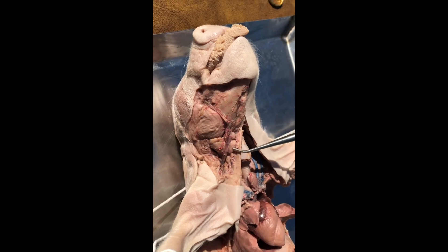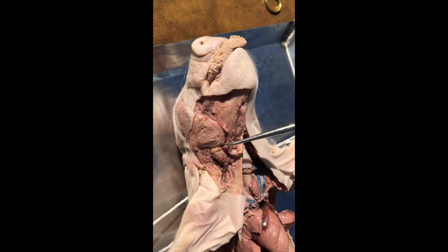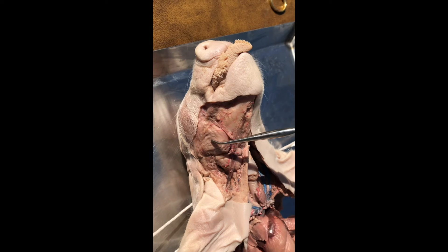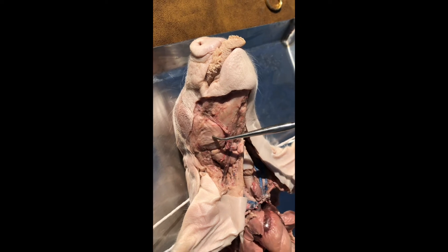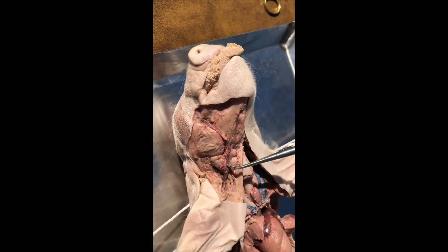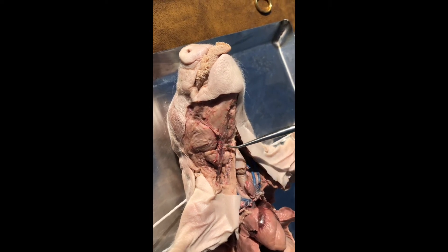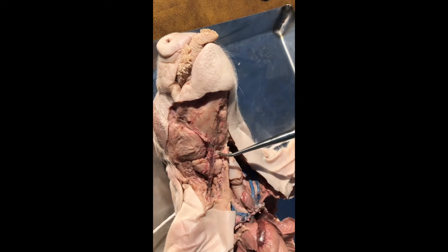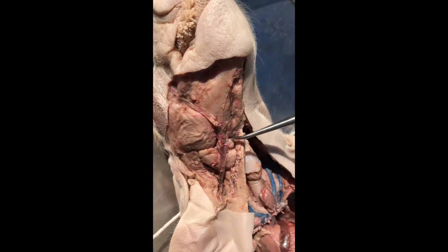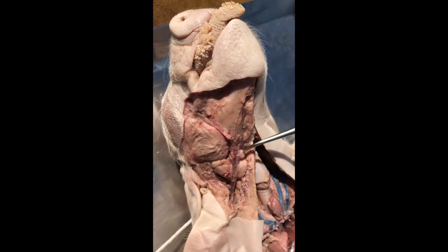This one's called the submandibular, which makes sense because the mandible's right here. This big cheek muscle that actually closes the mandible is called the masseter. So we have submandibular gland, and then sublingual — which makes sense, because it would be right under the tongue — sublingual gland.